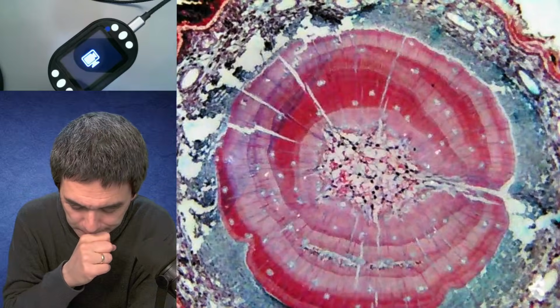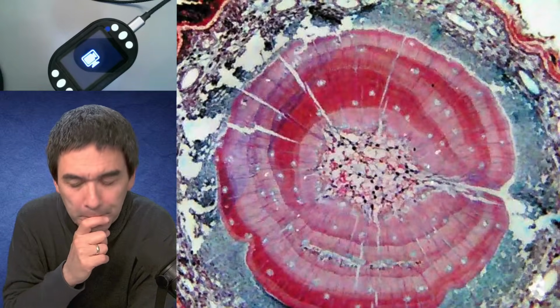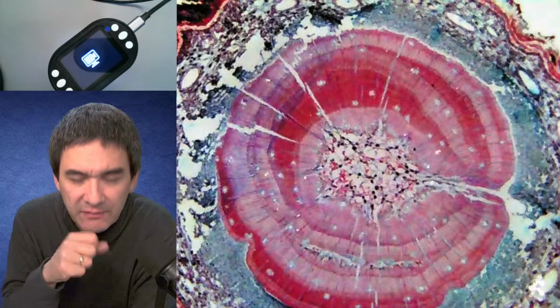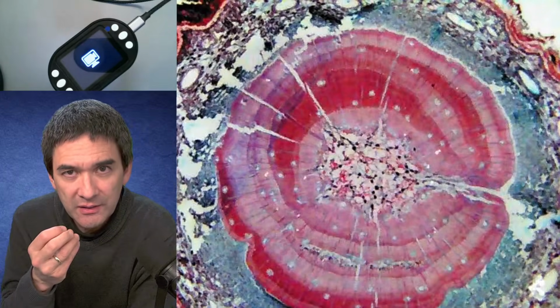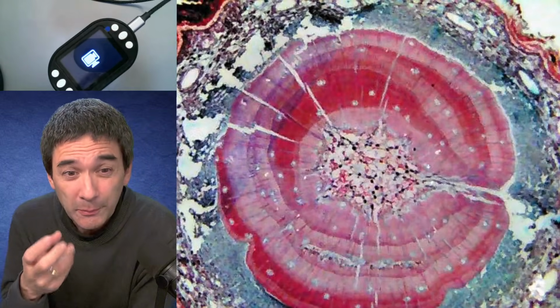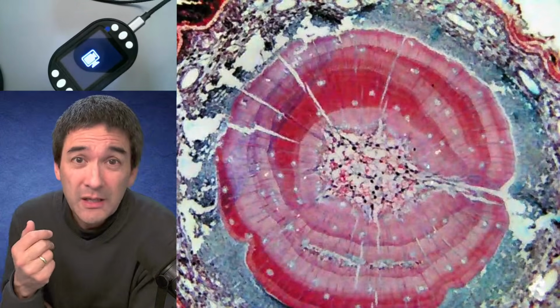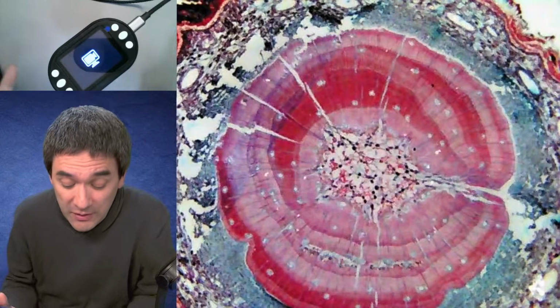But I don't know. The question that I have is to what extent do these devices actually allow students or children to learn proper microscopy technique? But maybe I'm overthinking it a little too much. Maybe who cares? Maybe, at least you have something to look at.